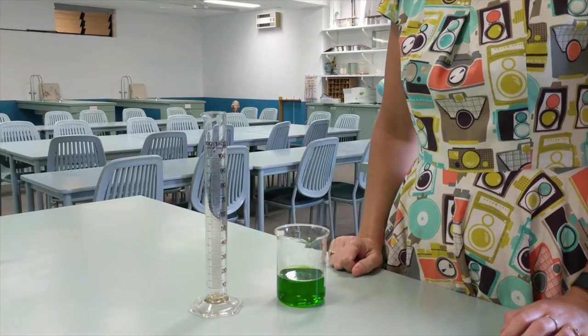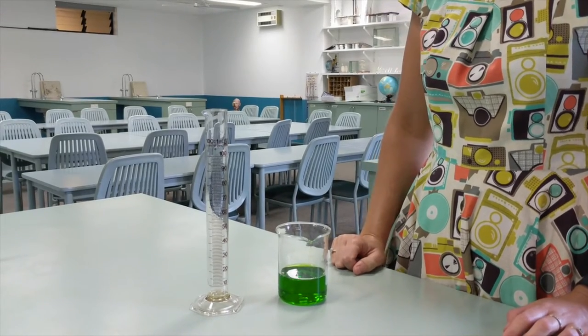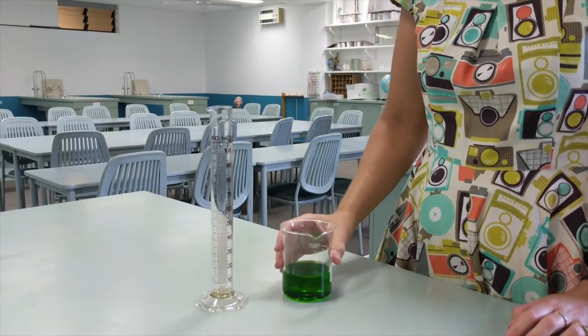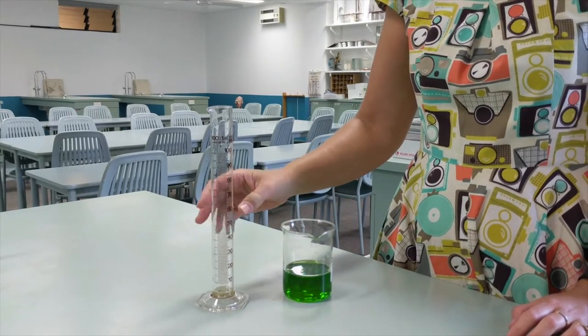I'm going to show you how to measure out an accurate volume of liquid. For this we need a measuring cylinder. So say I was wanting to measure out 80 mils of liquid.